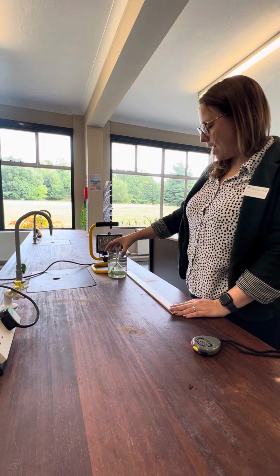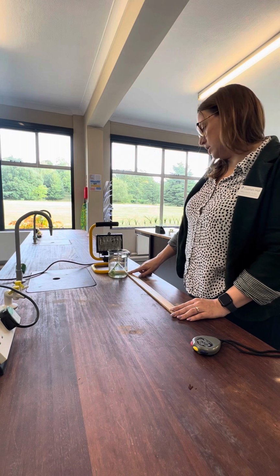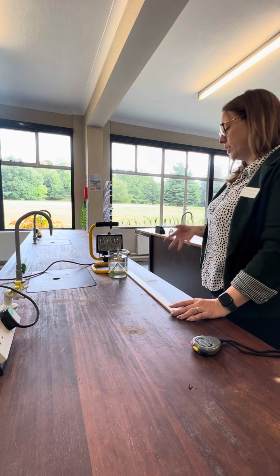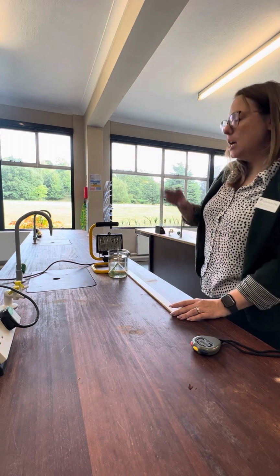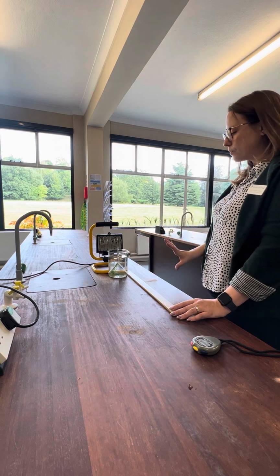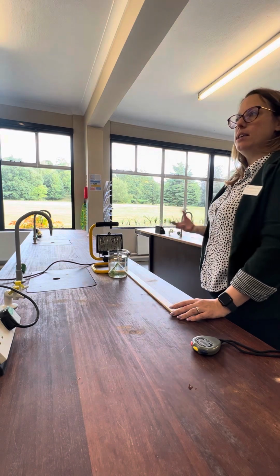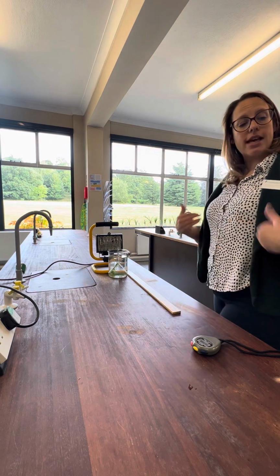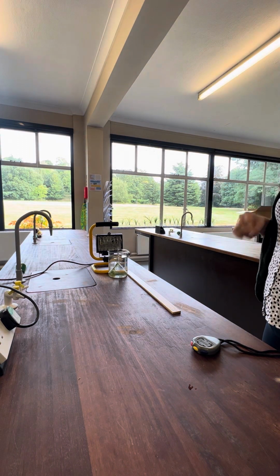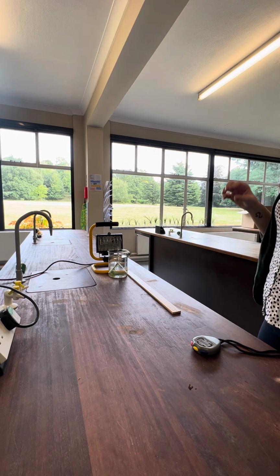So I'm going to have it, say for example, right here, which is about 2 centimetres from the lamp, and turn it on. I'm not going to turn the light on for the purpose of this video because it will just blind you and you won't see anything. But I'm going to turn the light on, leave it to acclimatise for 5 minutes, and then measure how many bubbles are produced in a set amount of time, because that's what I'm going to be measuring. So my dependent variable here is the rate of photosynthesis, and the way that I'm going to calculate that is by counting the number of bubbles in a set time period.